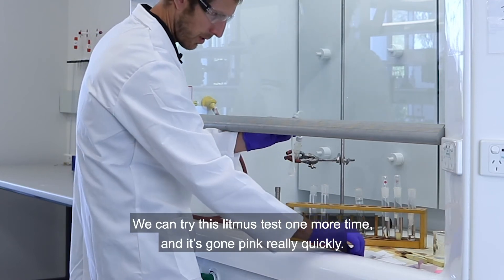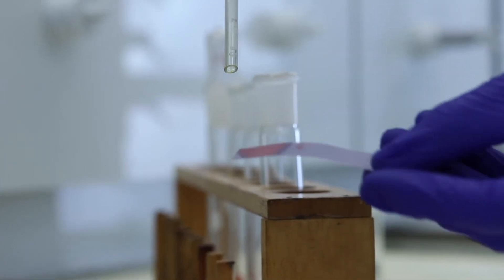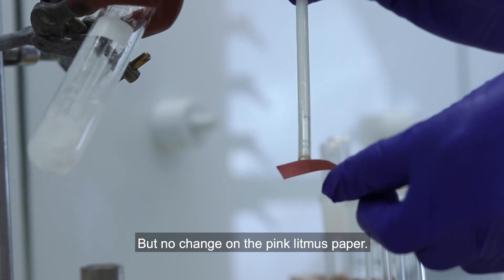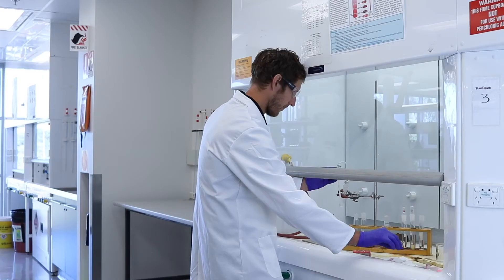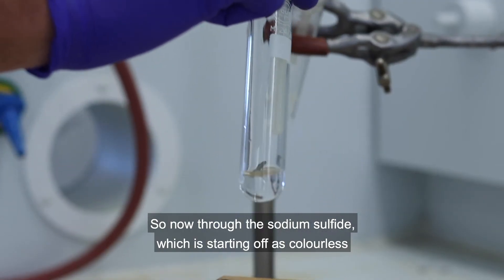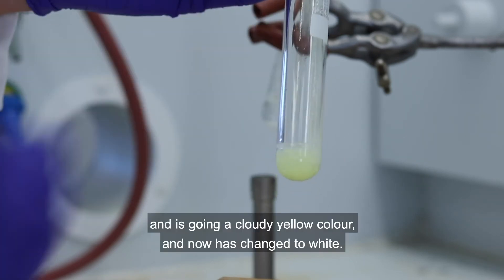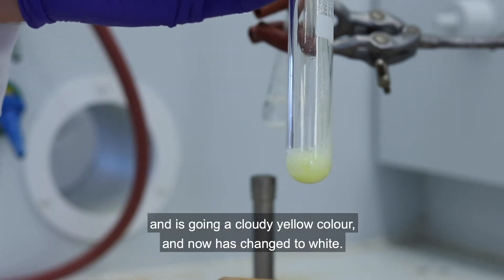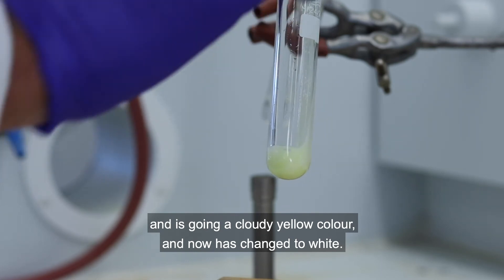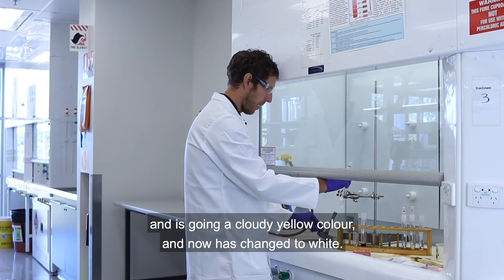I'm going to try this litmus test one more time and it's gone pink really quickly, but there's no change on the pink litmus paper. Now through the sodium sulfide, which is starting off as colorless, and is going a cloudy yellow color — and now it's changed to white.